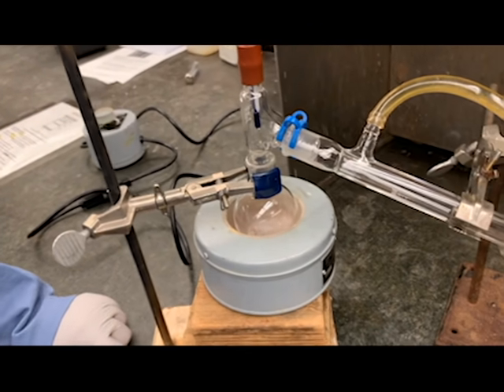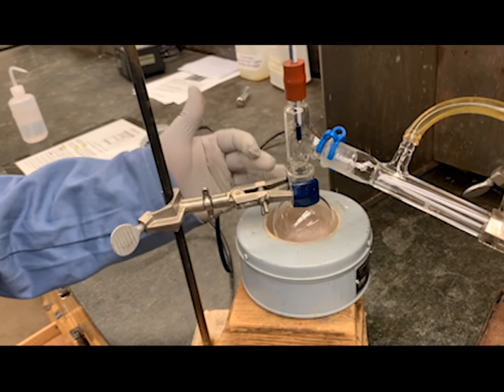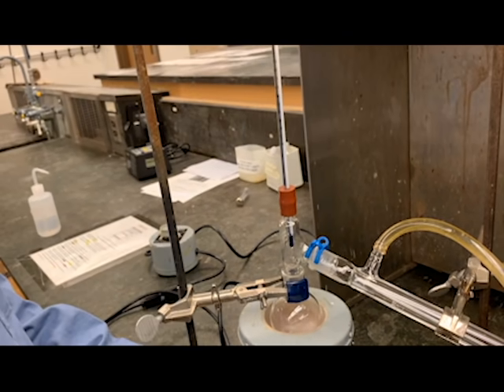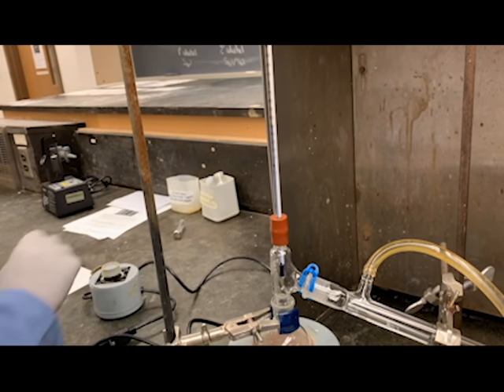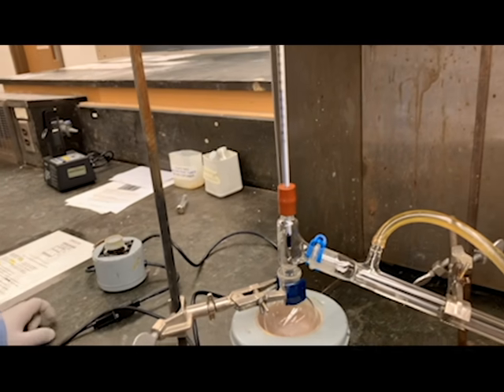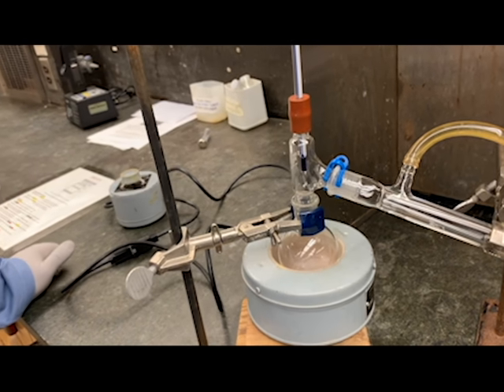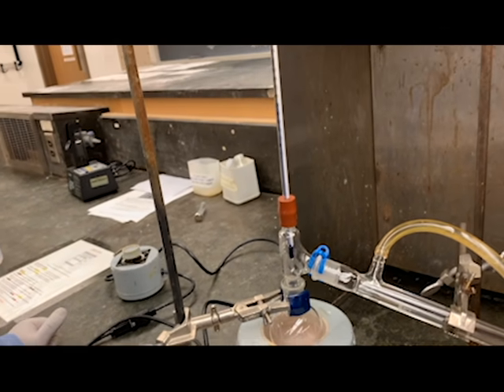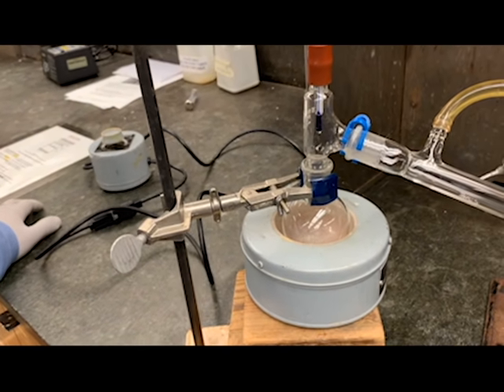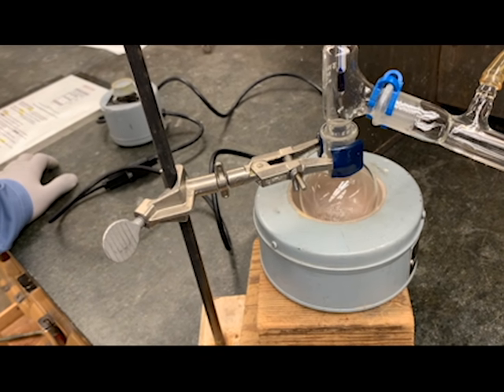Also, just be careful to see if your liquid here is all collected or gone. Keep on monitoring it and make sure you look at the temperature. The temperature is still increasing now, so if you want, you can reduce the heating portion of the thermal well a little bit if it heats too much. The temperature right now is at around 51, so I reduced the heating a little bit. And also when you're monitoring the liquid being collected, don't let it go to dryness.